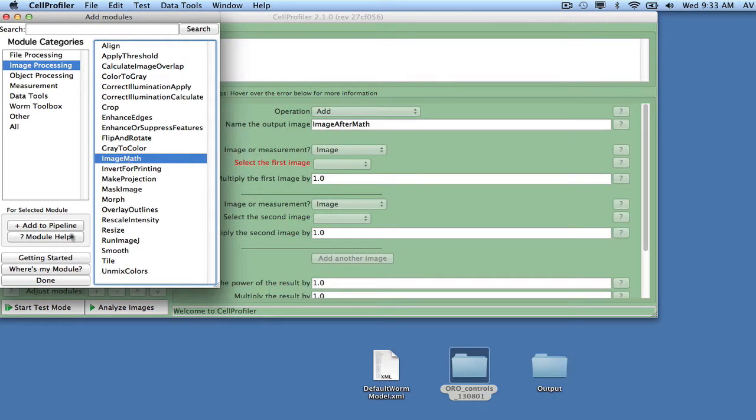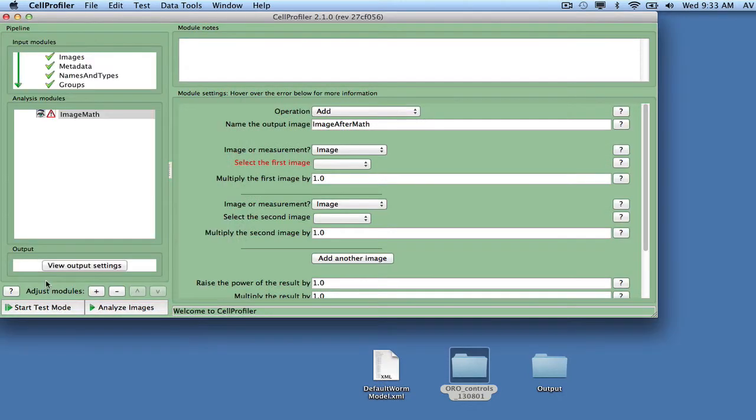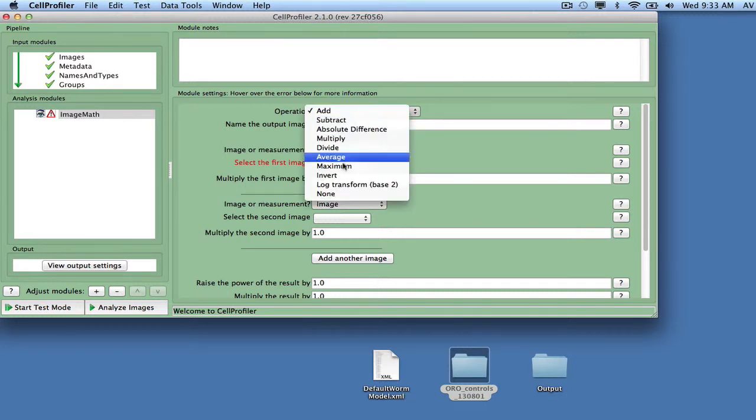Add the module by selecting and double-clicking it. The module has now been added to your analysis pipeline. When the module is selected, its settings are shown on the panel to the right where they can be adjusted. For this module, select invert as the operation, call the output image InvertedRaw, and select RawData as the input.